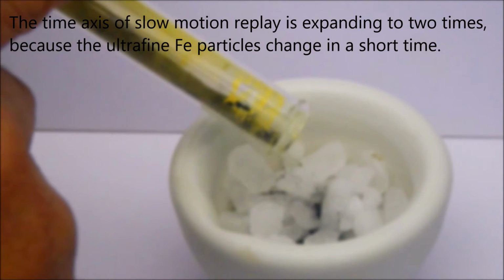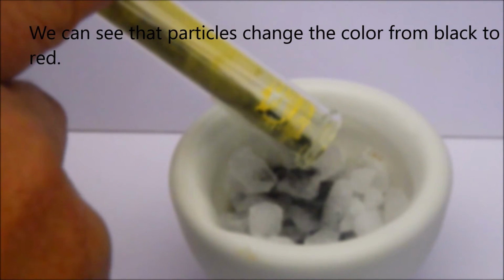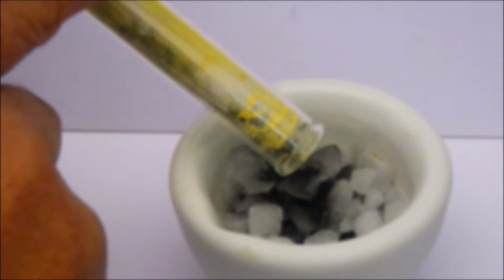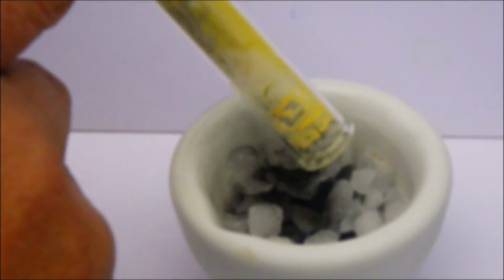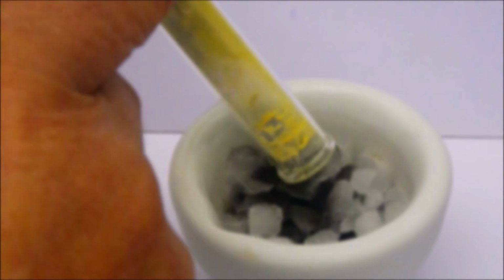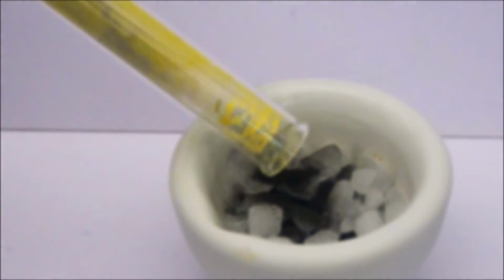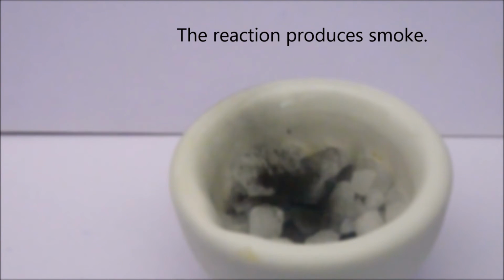The time axis of the slow motion replay is expanded to twice, because the ultra-fine iron particles change in a short time. We can see that particles change color from black to red, and the reaction produces smoke.